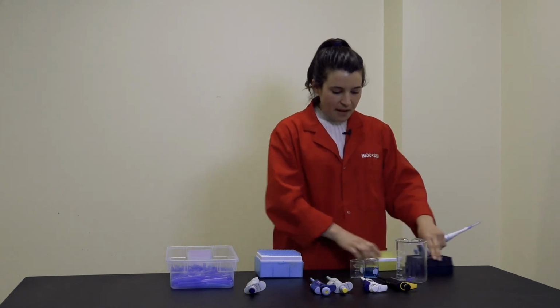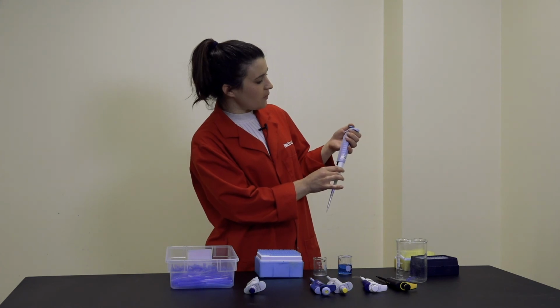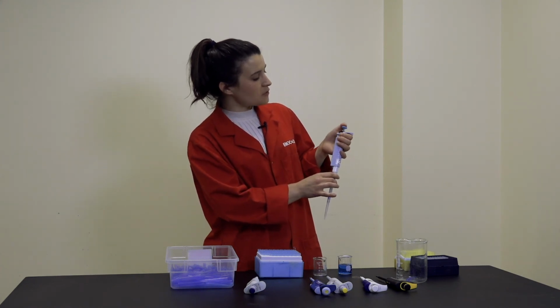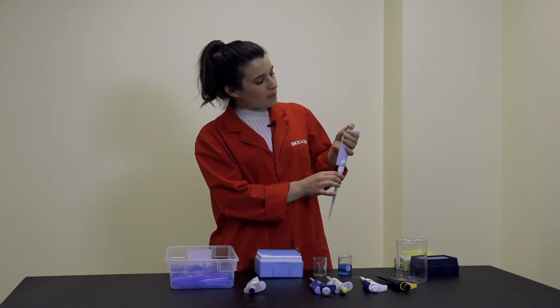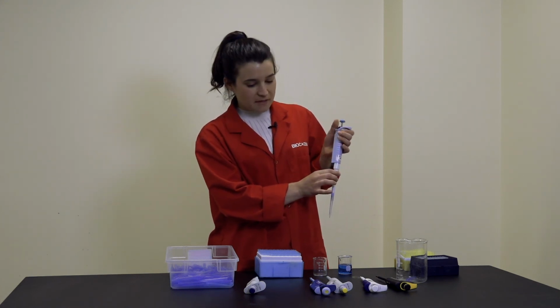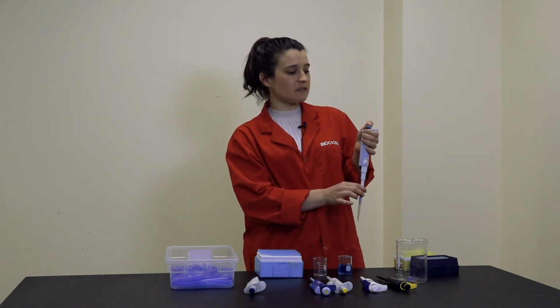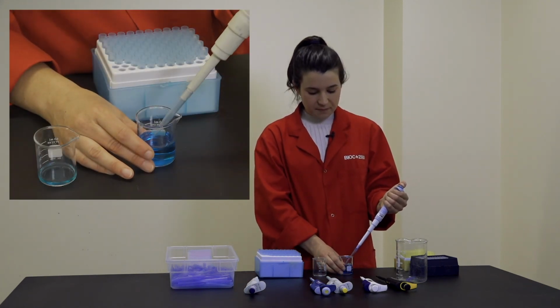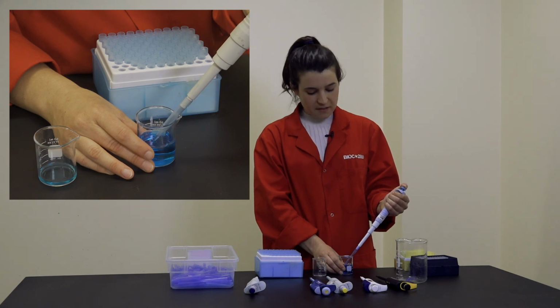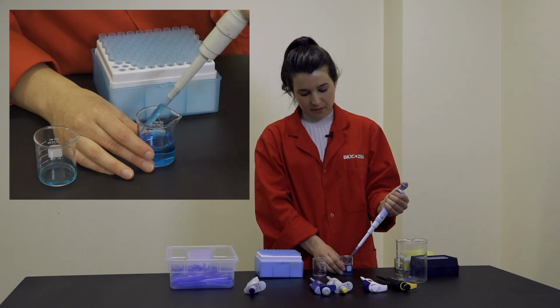Okay, so in order to pipette, first you need to know that pipettes typically have 2 piston stops. The first stop is used to pick up or aspirate the liquid, and the second stop is used to dispense the liquid. So I'm going to push the piston down to the first stop, hold it in place, place the tip in my liquid, and then slowly draw the piston up. And I'm making sure that I'm not picking up any air bubbles as I do this.